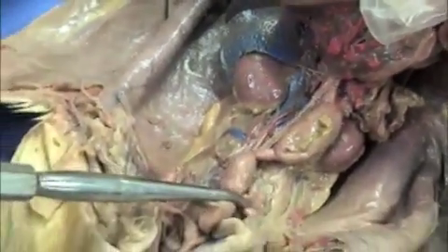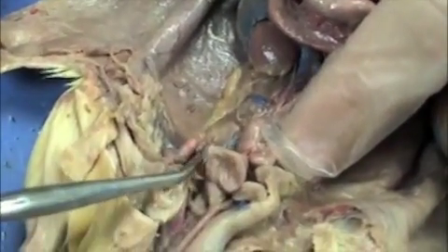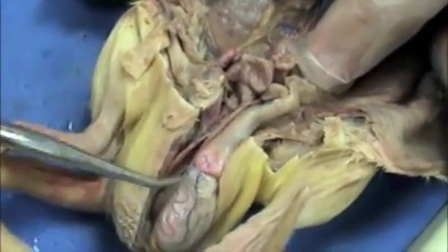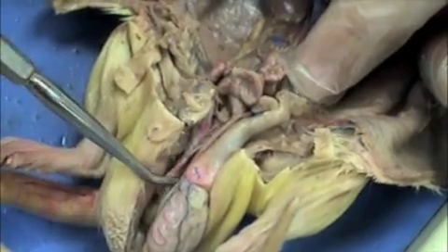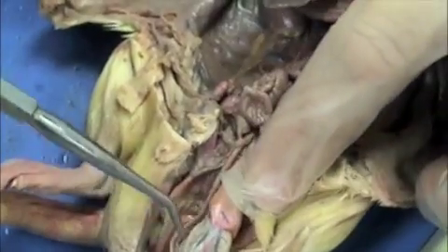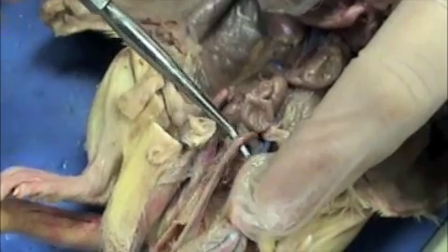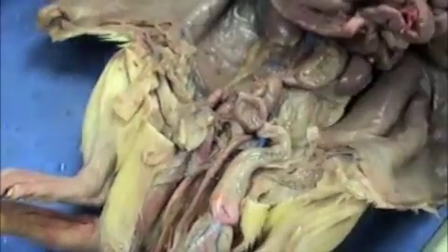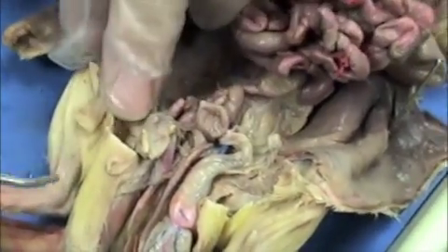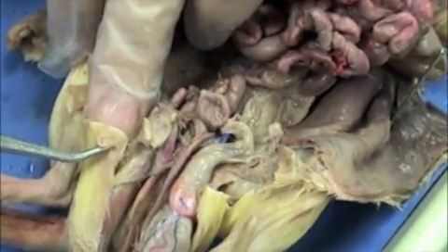These are the seminal vesicles — the little curly things. This is the bladder. This is the prostate gland. This is the testis here that sits in the scrotal sac. And this white tube here, leading from the bottom of the testes all the way up to the pelvic cavity — it carries sperm. That's the vas deferens. The urethral orifice is the opening from the urethra, and this is the urethral orifice right here.